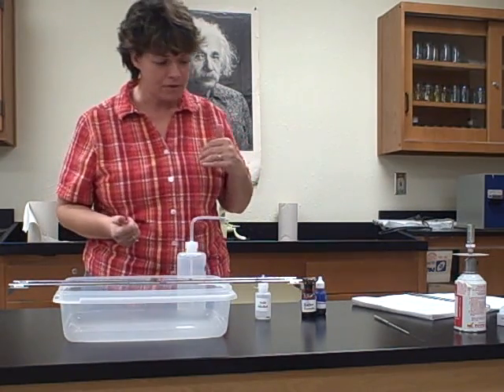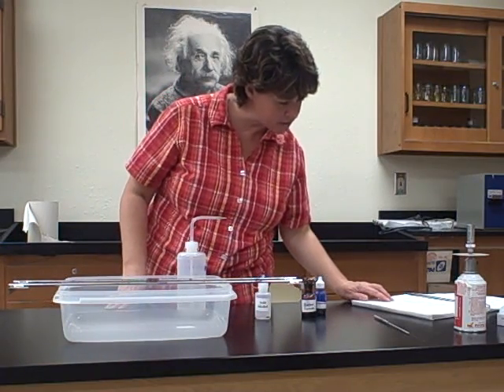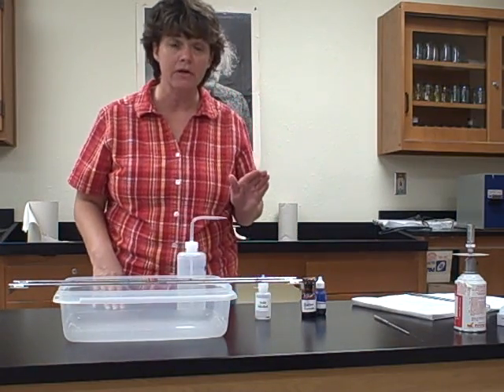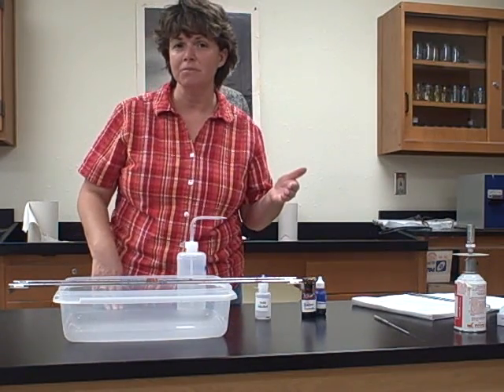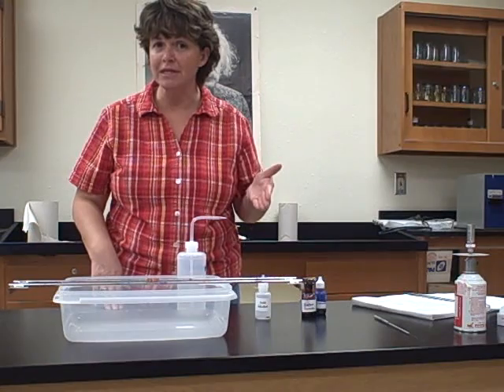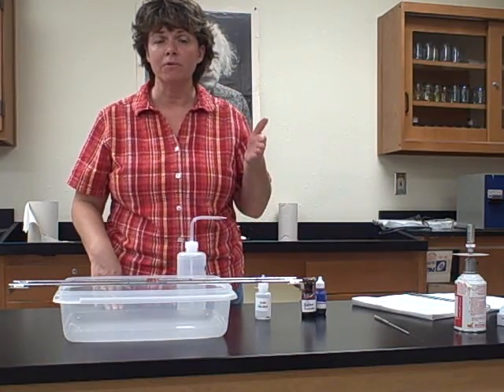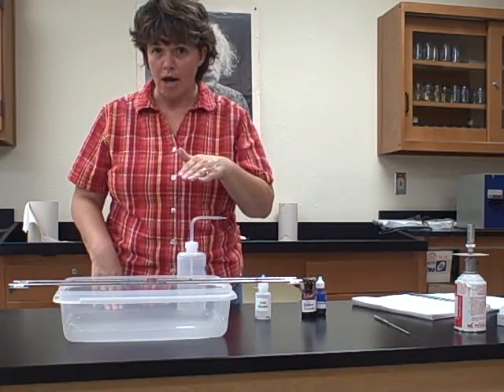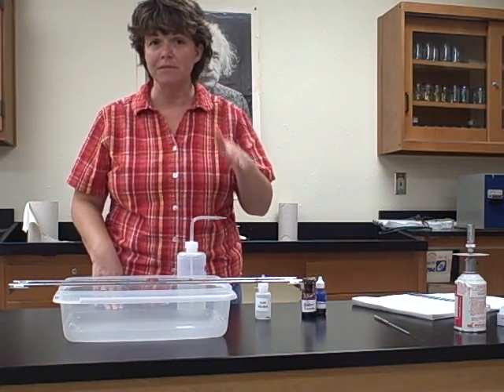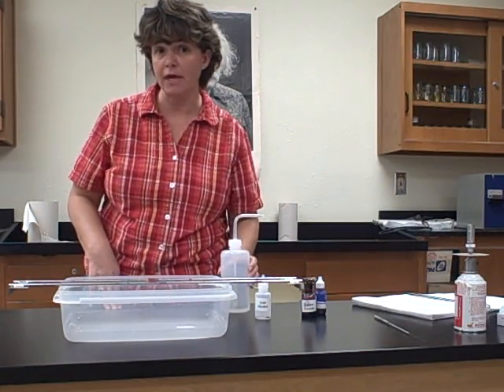Okay? So for this, we have our slide, and if you look on the first step, on page 41, it says prepare and fix a smear, just like we did before. Remember, if it says prepare and fix a smear, you'll go back to the procedure that you did at the beginning of preparations of smears and stains. So remember, that means you put the bacteria on, you let it dry, and then you heat fix it. That has to be done unless you're told differently. And we'll see that today, that there are times where we're not going to do that.